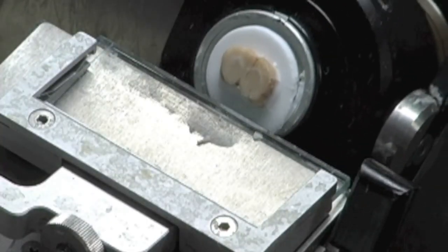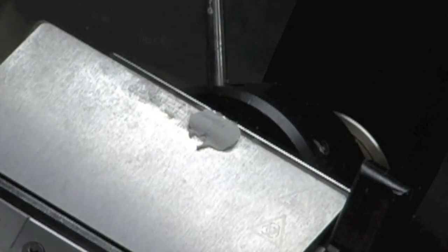After we mount the brain and position the chuck, we can begin to cut the brain. We don't start using slides until we see the first indication of the injection point.